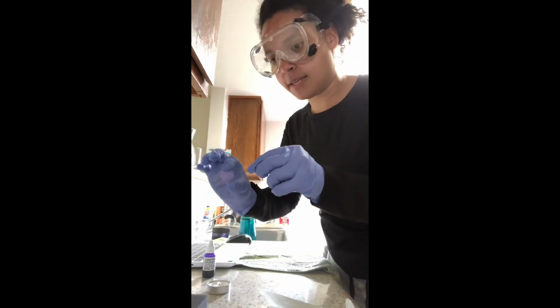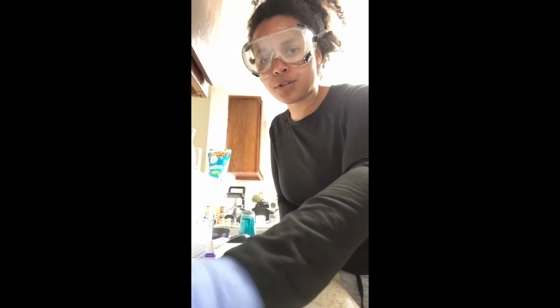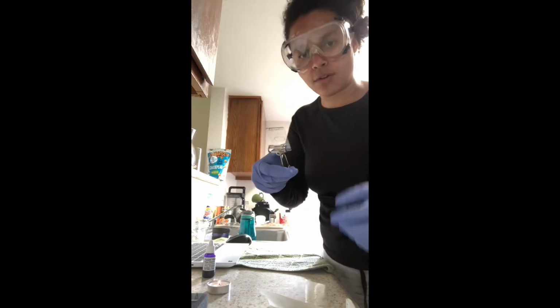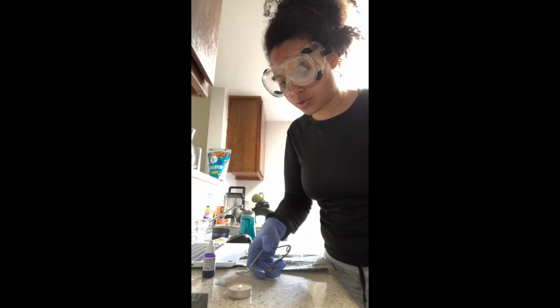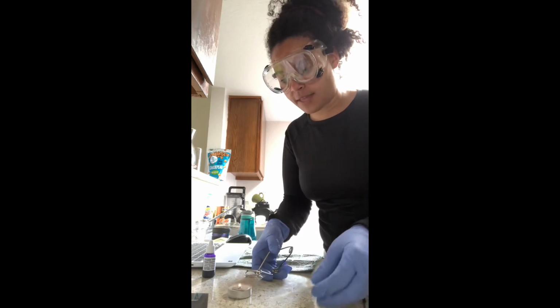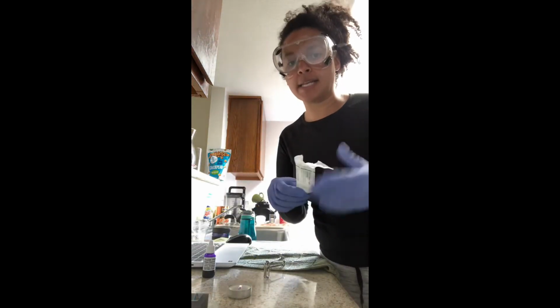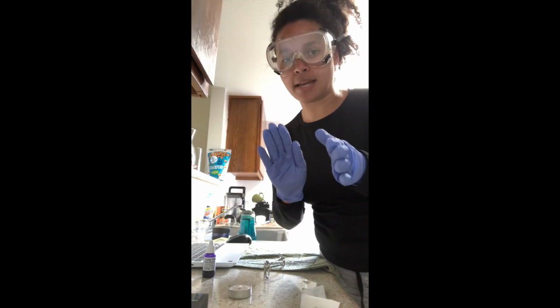Going back to my first stain, my direct sample from the mouth, the first one, I will use my tube clamps here, and I'm going to heat fix it. So I'll take it over the flame 5 times. 1, 2, 3, 4, 5. And this will have the cells stick to the slide. And I will let this one cool for 10 minutes. Then after the 10 minutes, I will stain it. So that completes the first part, and I will let it cool for 10 minutes and I'll restart the video again.